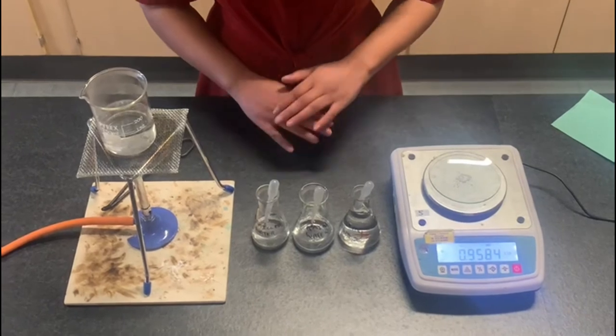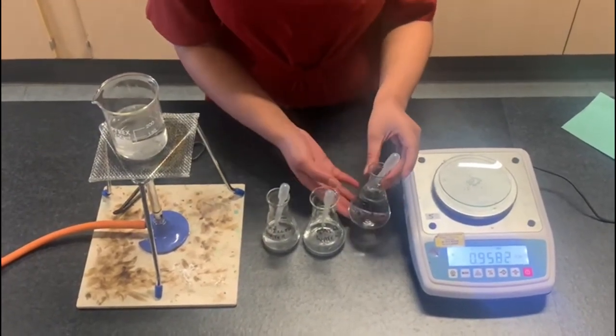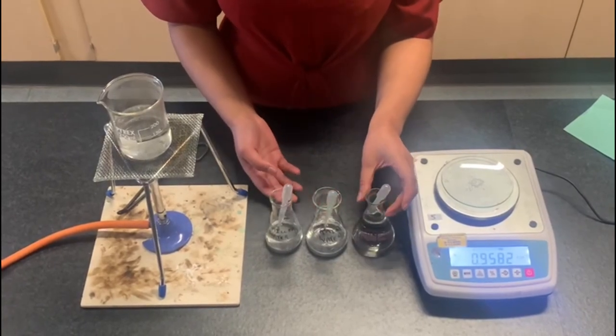You will then need to repeat the steps for activity two for the remaining three water samples so spring water, rain water and distilled water.